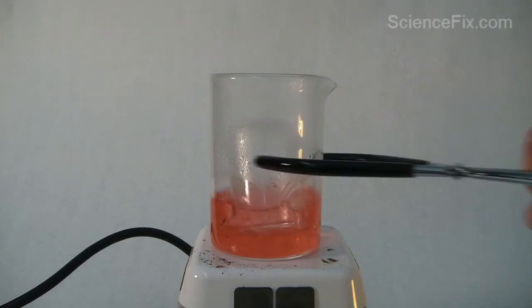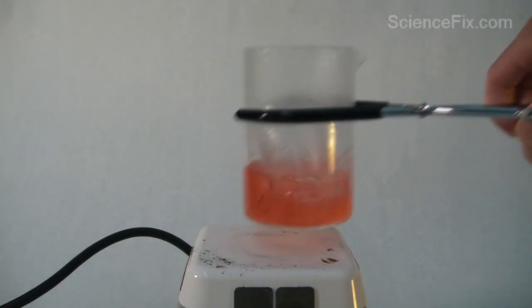The water continues to boil and now I'm removing the beaker from the hot plate.